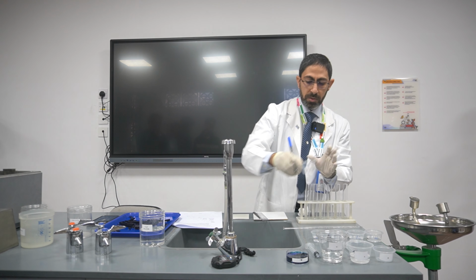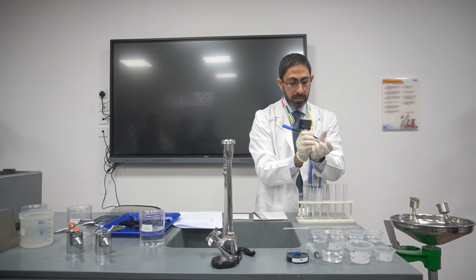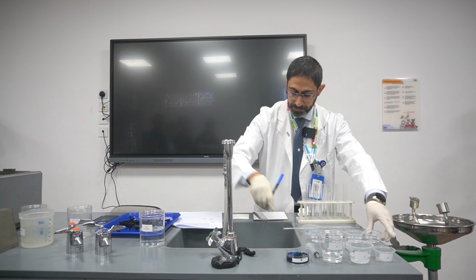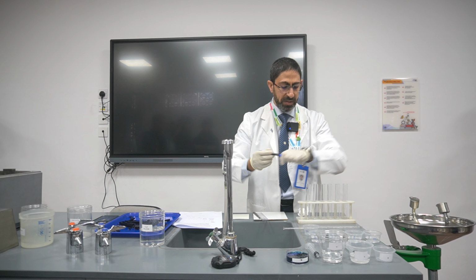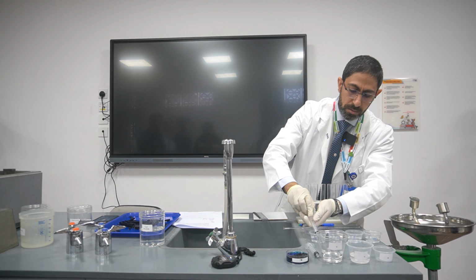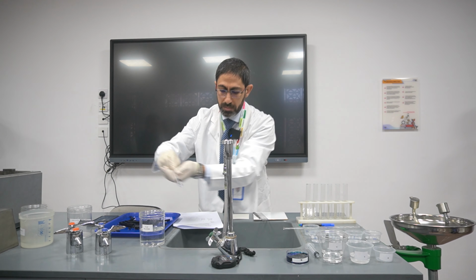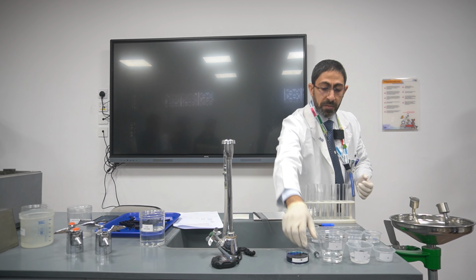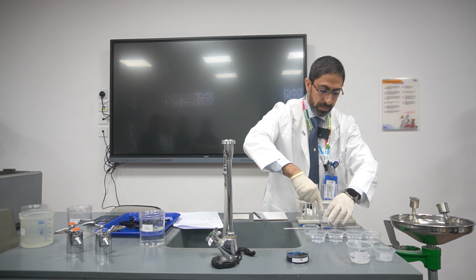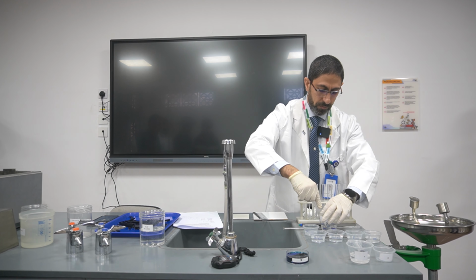Yes, okay. So here we go. I'll just make it a little bit obvious. Perfect. Afterwards, I'll make it here. I don't need this anymore. I need it in a couple of seconds. Okay. So 2 centimeter of 0.01. Then I will take 18 cubic centimeter. Here is 10. Here is 8.